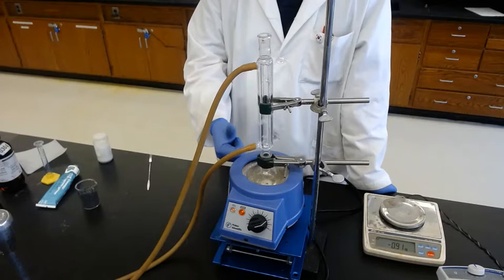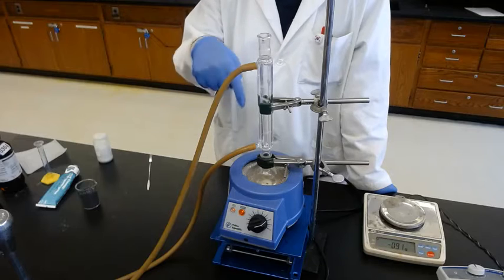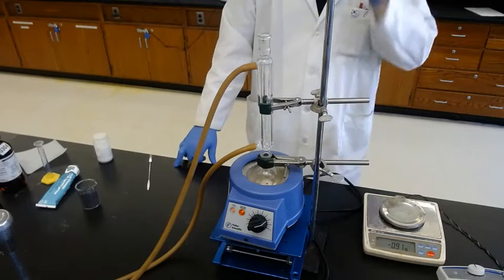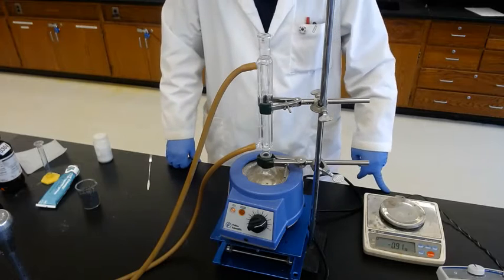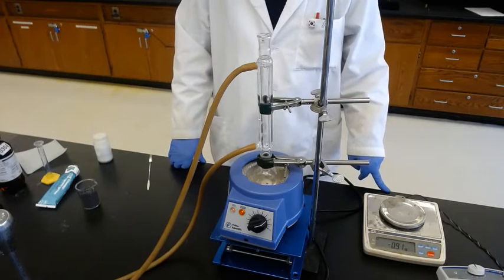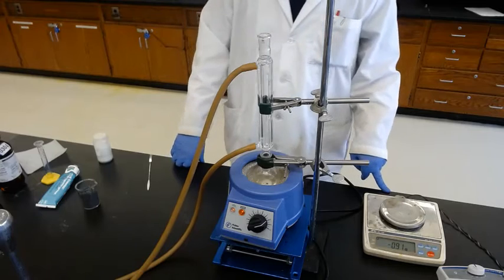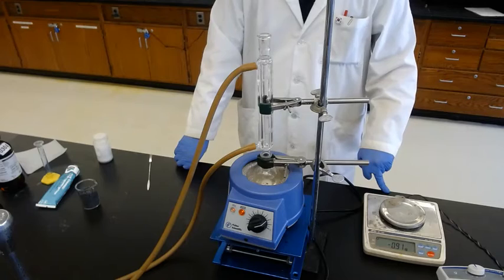So vapor moves up, condenses, turns into liquid and falls down. Up, down, up, down. So it's called reflux. You can control the temperature depending on which solvent you are using. Especially when a side product is a gas, the gas can escape and the reaction shifts to the product side because of equilibrium, so the reaction goes faster. There are many benefits of reflux.